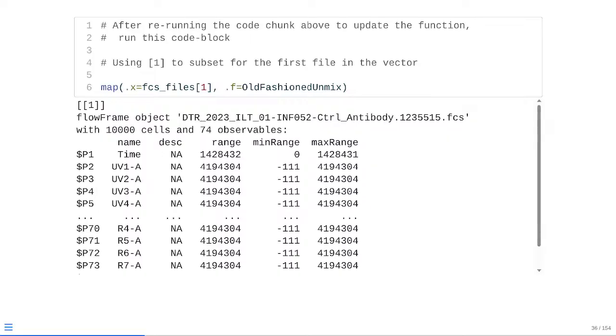Sure enough, at that point, if we refresh our code to refresh the function in our environment, and then we run our little testing code block directly below, in this case, just designating the first FCS file path within the FCS_files vector, you see we're getting back a flow frame object being printed to our console window. And if we look at it right now, we can see it's very much the same kind of formatting that we got from import.